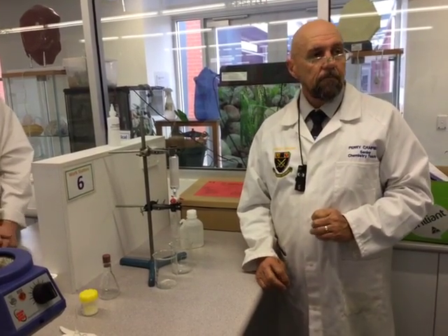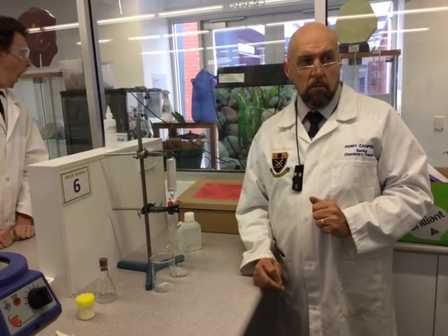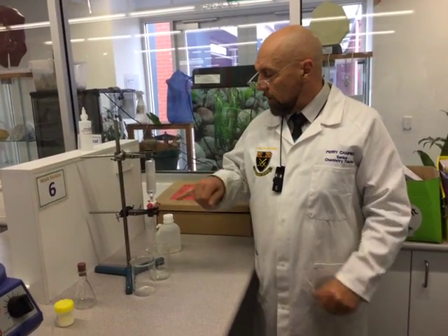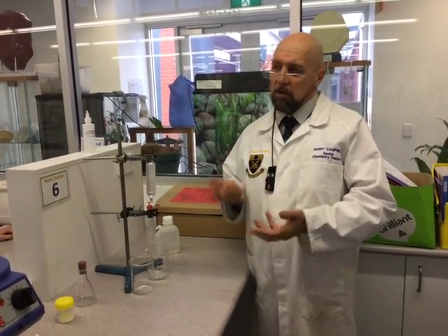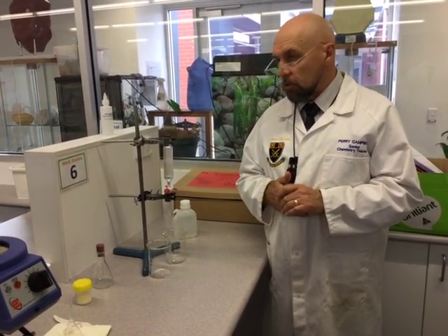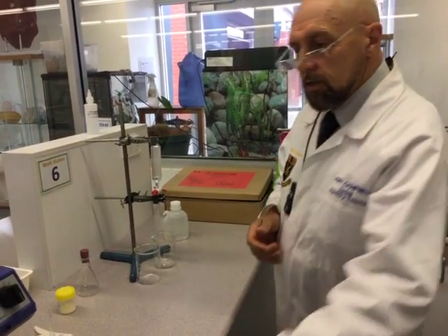It forms two layers where the soluble components go into the aqueous layer. So we're trying to get stuff to go into the aqueous layer — what are we trying to get there? Alcohol. Maybe the acetic acid, which we know is water-soluble — it's unreacted. Maybe some unreacted sulfuric acid. Maybe some of the butanol, but butanol is probably not very water-soluble. So we're going to let it sit for a little while. Sometimes this is a quick process, sometimes it's a slow process.